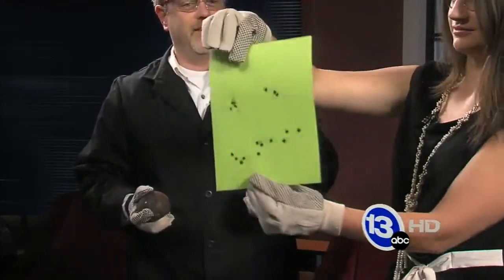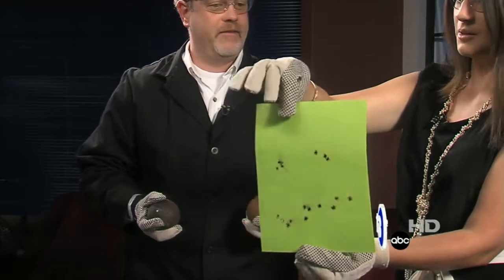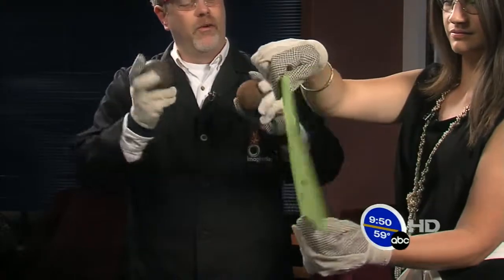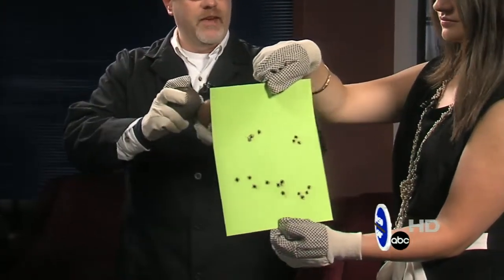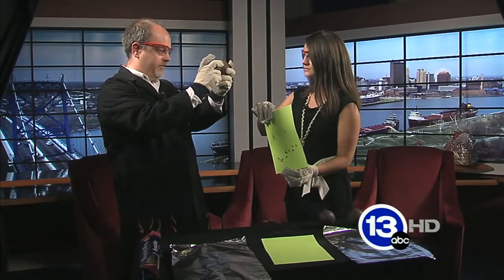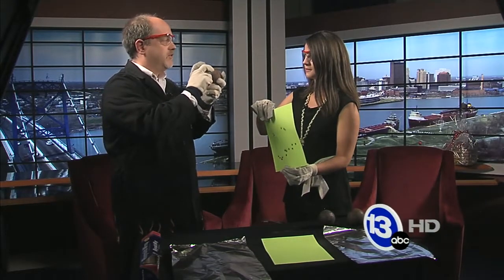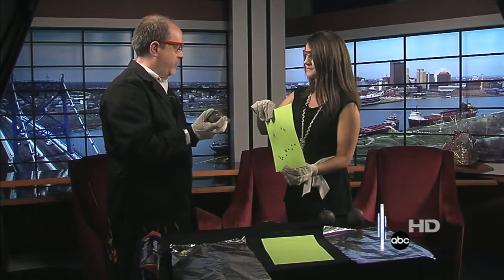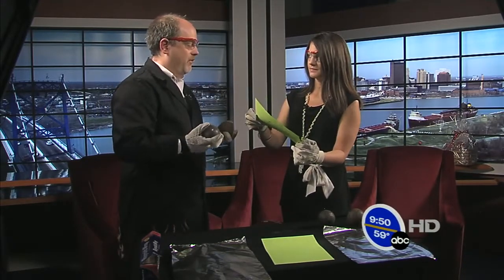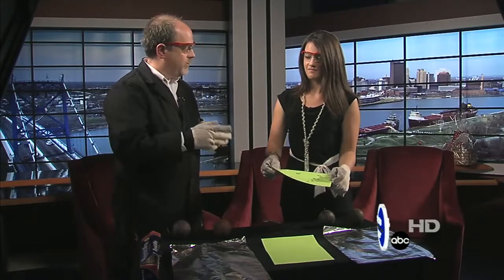What does that smell like? It smells like burnt paper. Because we burned holes through the paper. The whole idea here is that when these two spheres come together with lots of force, they meet in only one tiny little spot. So lots of force in a small area generates an immense amount of pressure. We could burn holes in paper again, or we could try to amp it up a bit with a different sort of material.